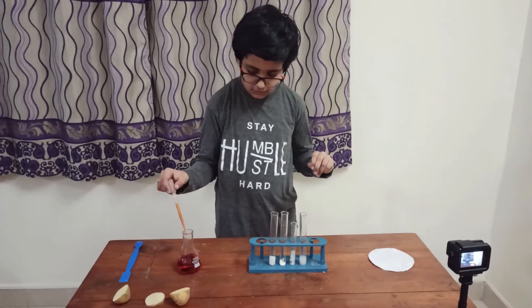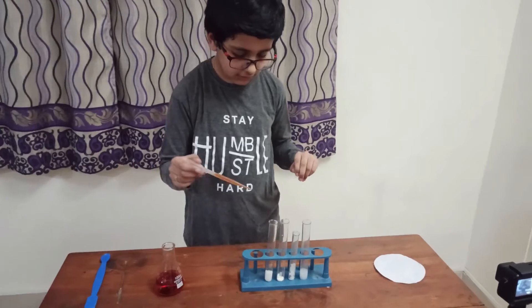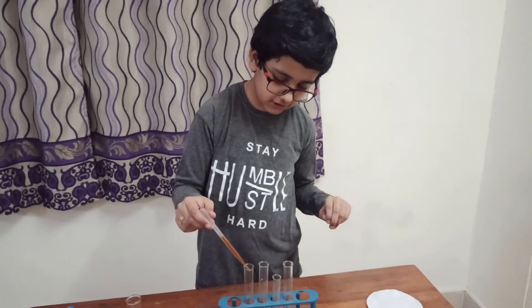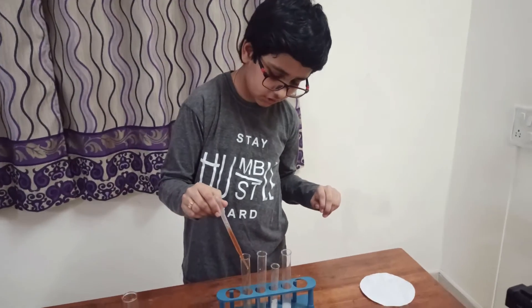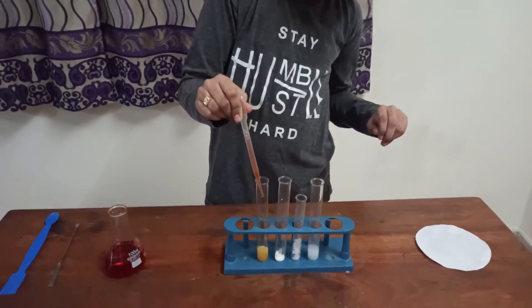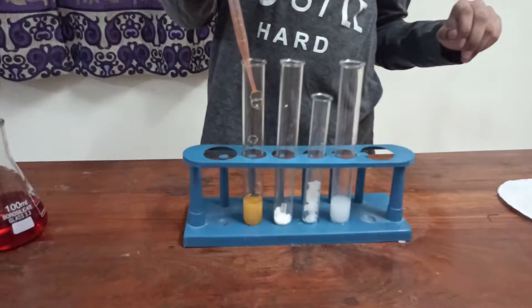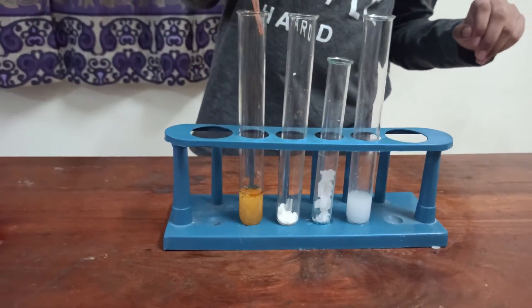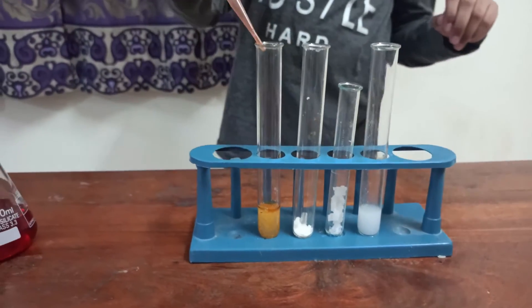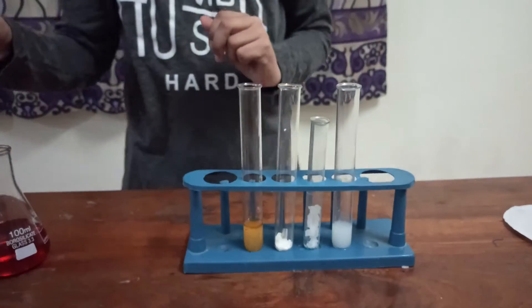So first, we'll add iodine to some sugar. As you see, there is no reaction. It hasn't turned a black color.